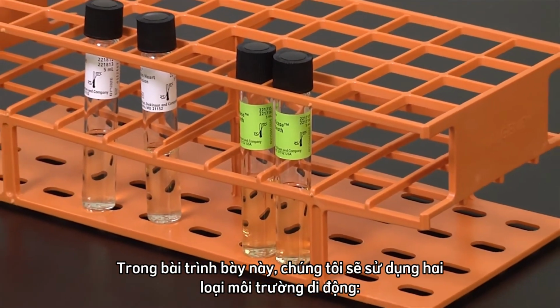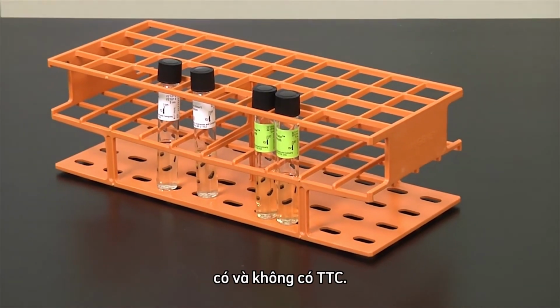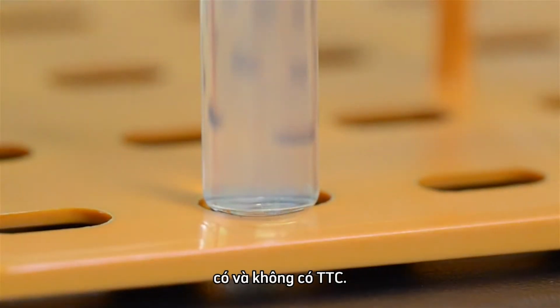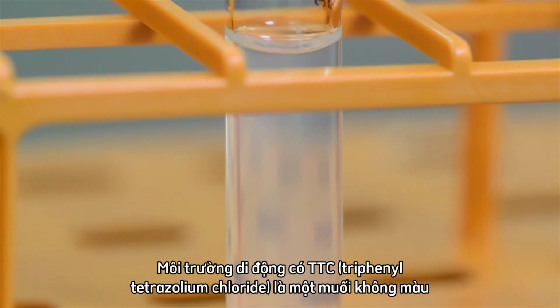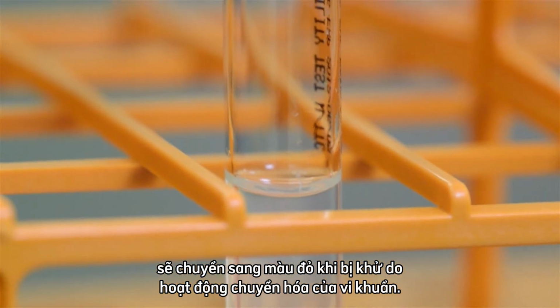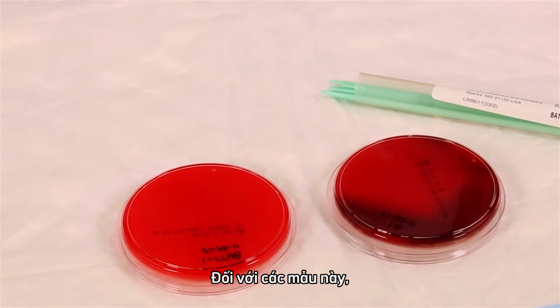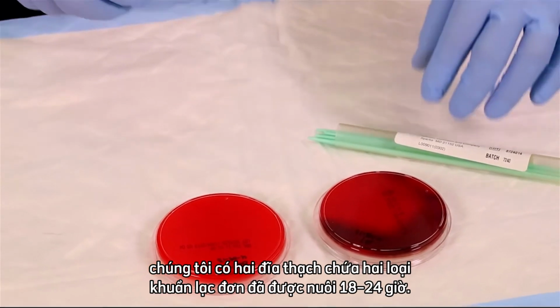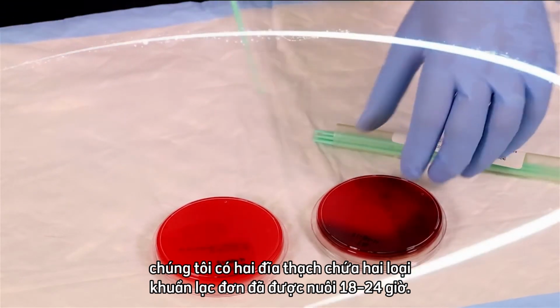For this presentation, we will be using two types of motility media: motility media with and without TTC. Motility media with TTC, triphenyltetrazolium chloride, is a colorless salt that turns a red color when it becomes reduced as a result of bacterial metabolism. For our samples, we have two agar plates containing two isolated colony types that are 18 to 24 hours old.